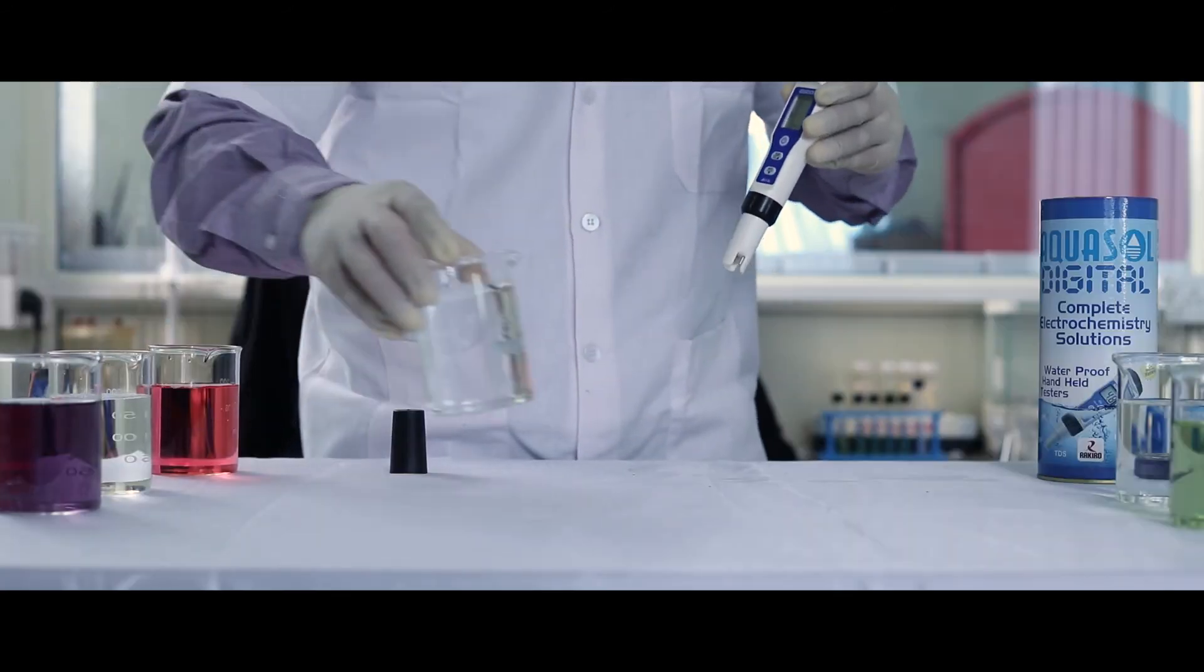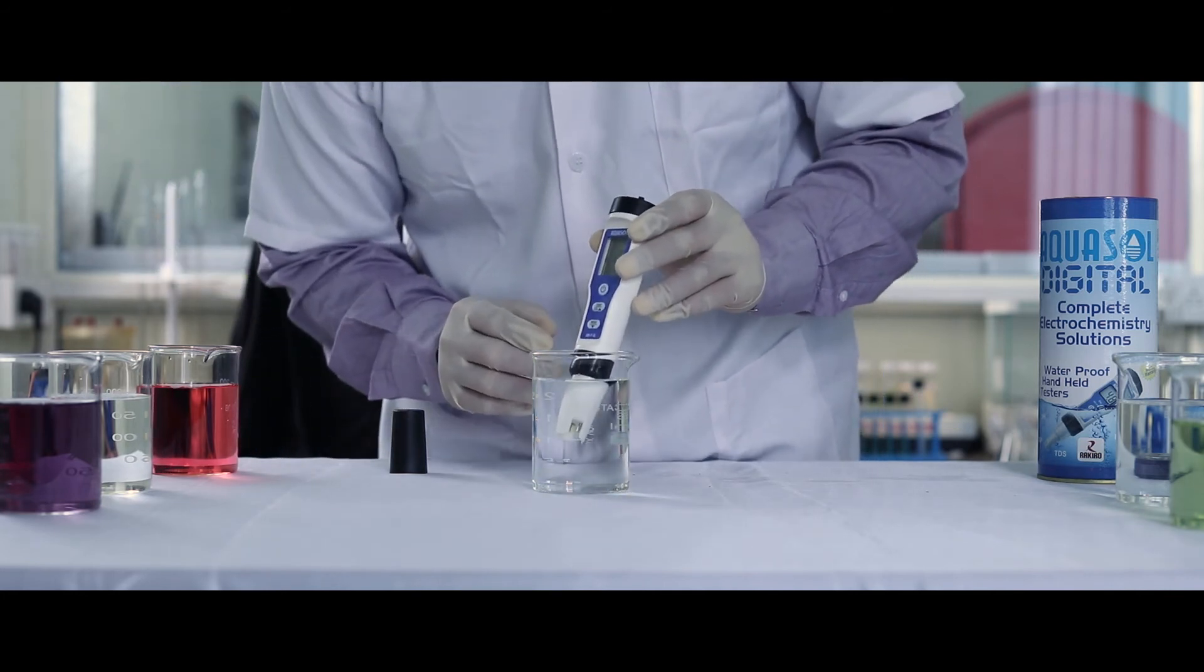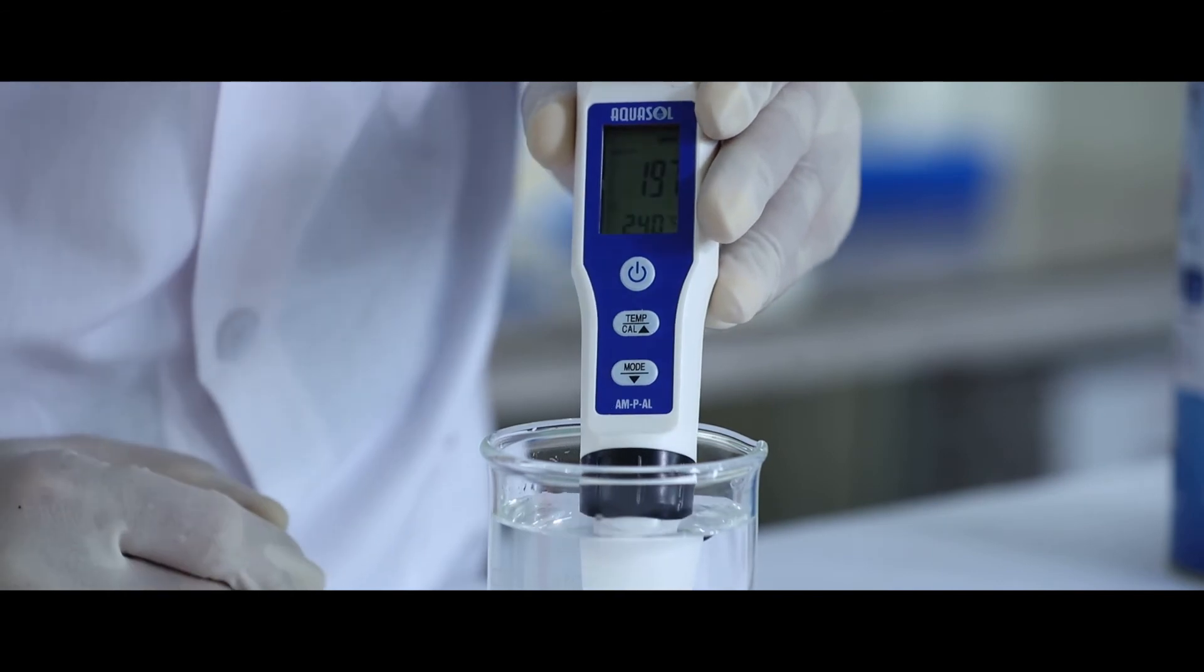Let's test the sample for conductivity. Dip the electrode in the sample. Note the conductivity reading of the sample.